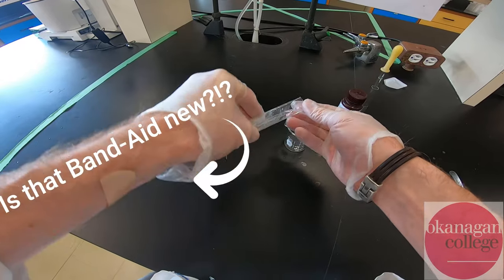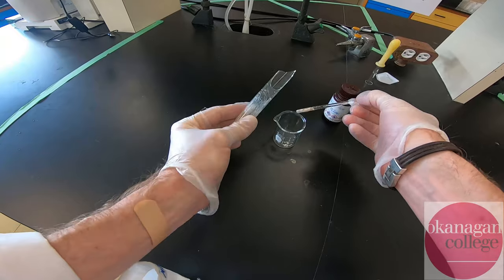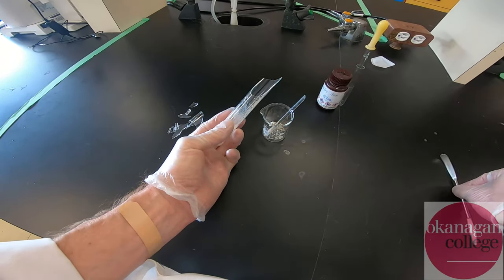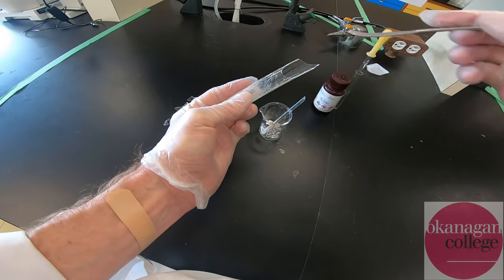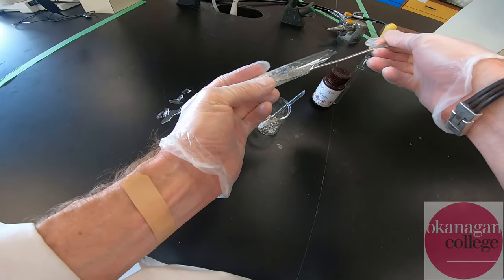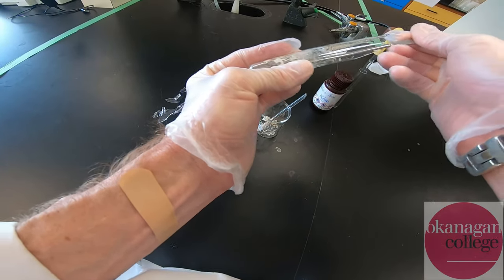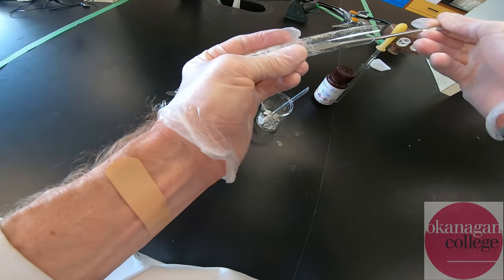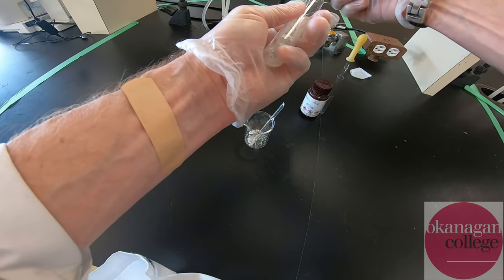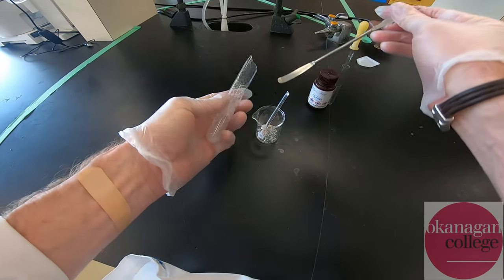I'm going to transfer this material. You can see we have a solid plug of material. There are some glass shards — that's going to be fine. I'm going to transfer that to a secondary container. Clearly this test tube is past its best before date. The stuff is really pretty solid at this point — it's almost welded itself onto the side of the test tube — and that's certainly what led to the incident with the broken test tube.